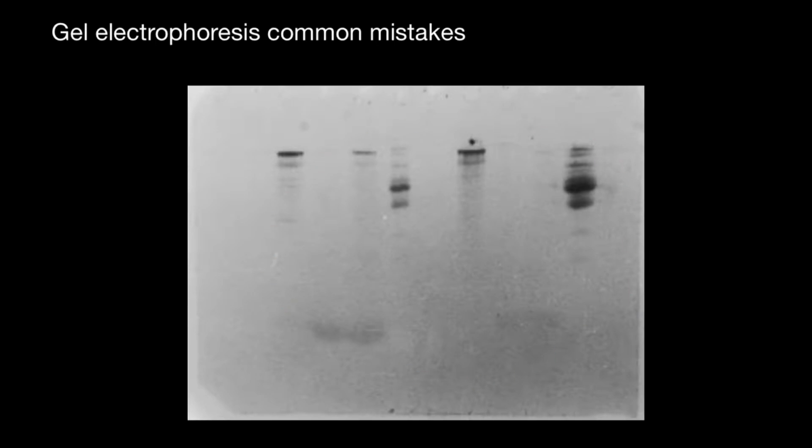So notice that the smaller proteins diffused rather quickly out of the gel, while the larger ones at the top diffused much more slowly and took the stain.